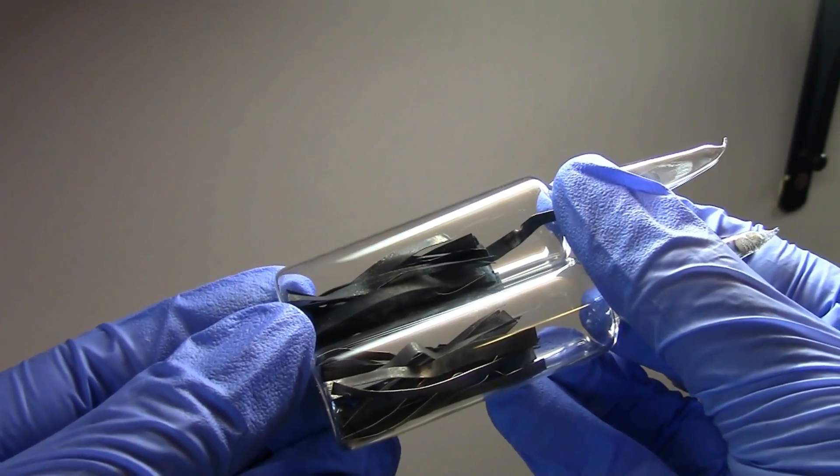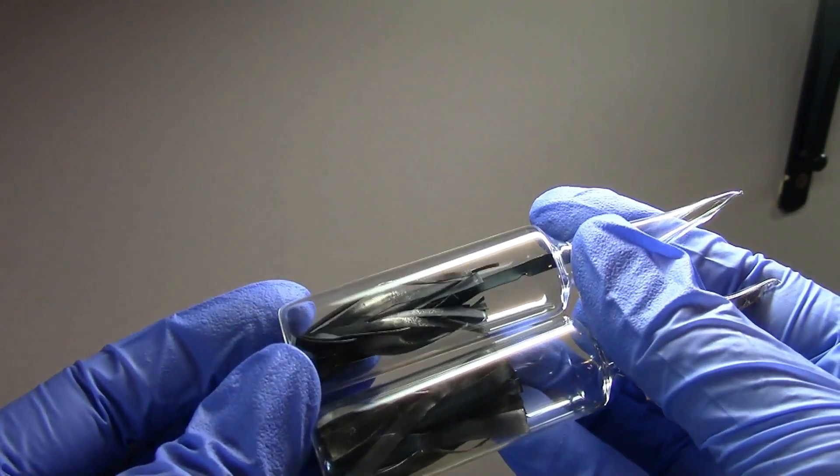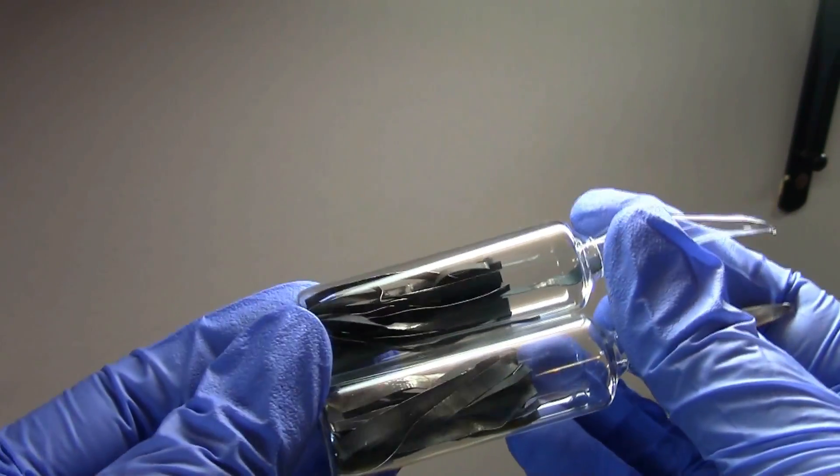So here's those two lithium ampoules under different lighting so you can maybe see the shininess a little bit better. You can see it's definitely tarnished but still not too bad.